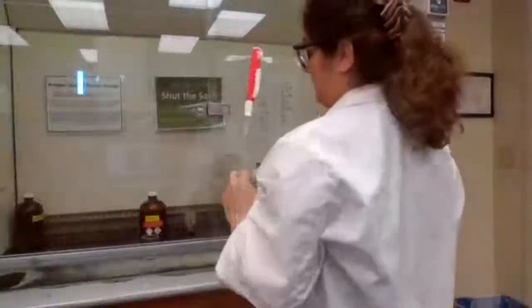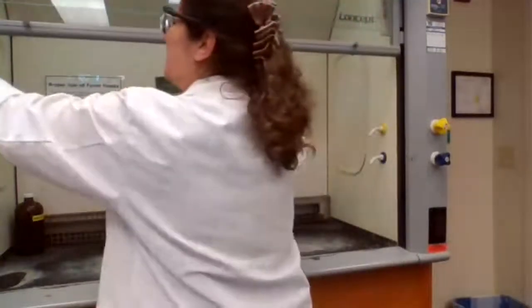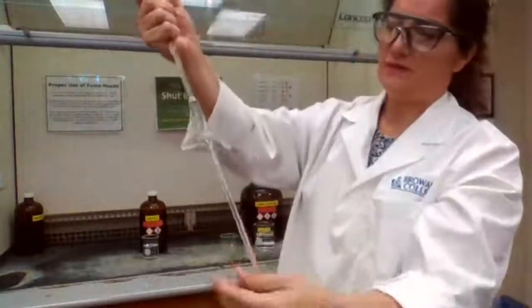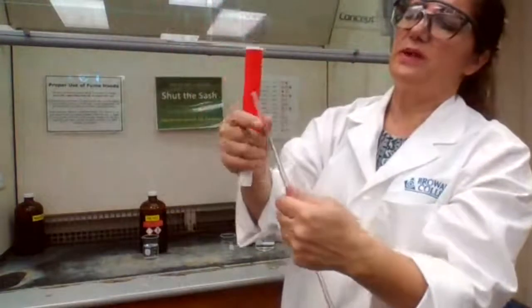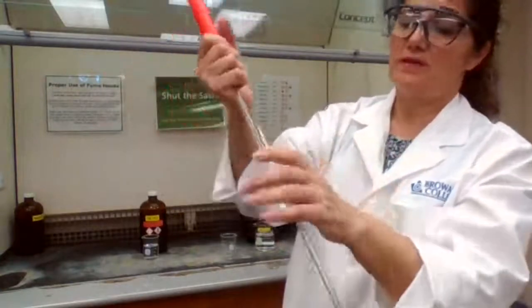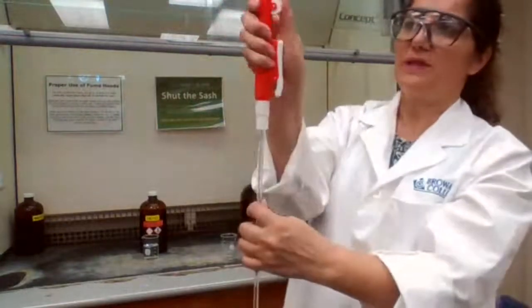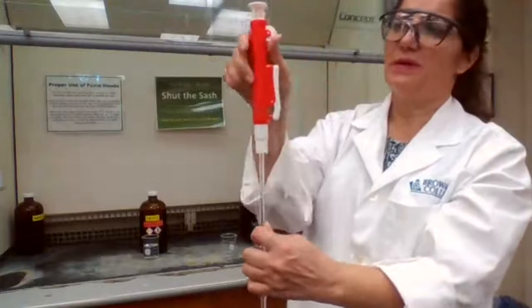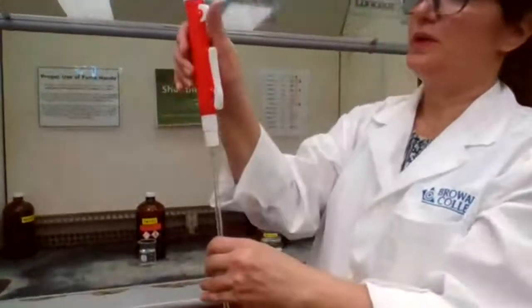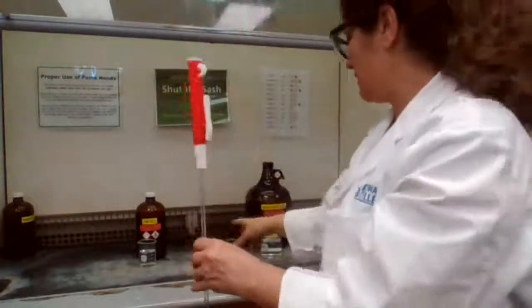Bring it here so we can pipette the acid. To use the pipette, you insert the end of the pipette into the pipette pump. You always hold onto the glass so it doesn't break. To pull the liquid in, you wheel down the pipette pump. This design of the pipette pump, that's how it works. You wheel it down to pull the liquid in. To wheel up, you dispense it into the beaker.